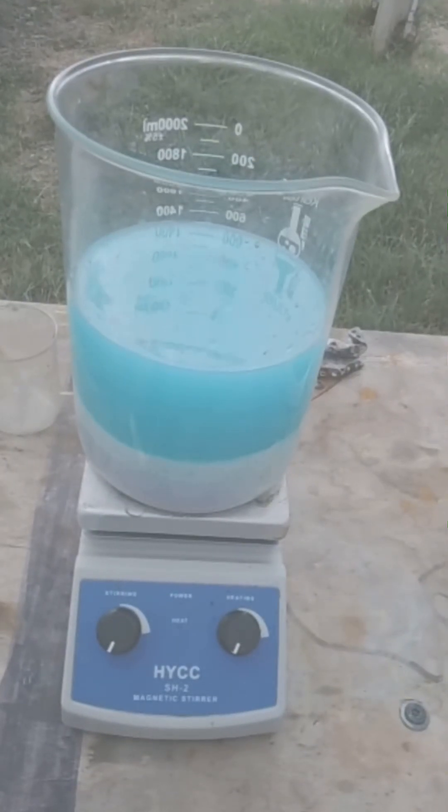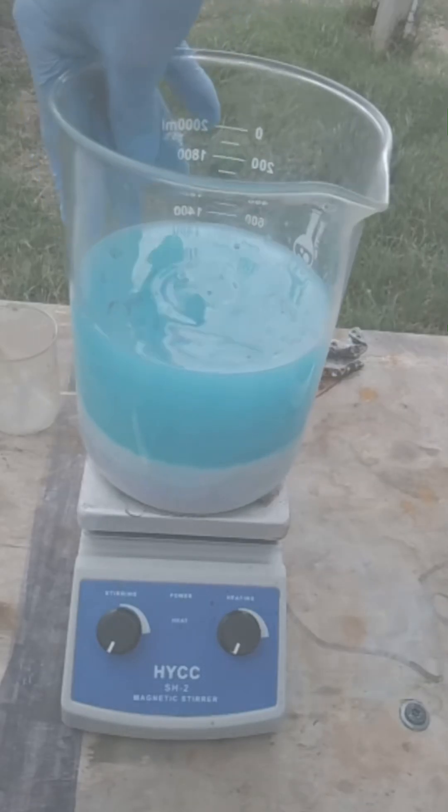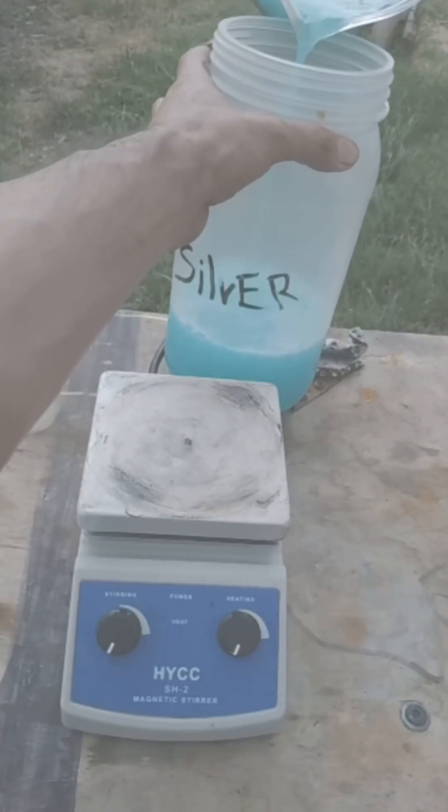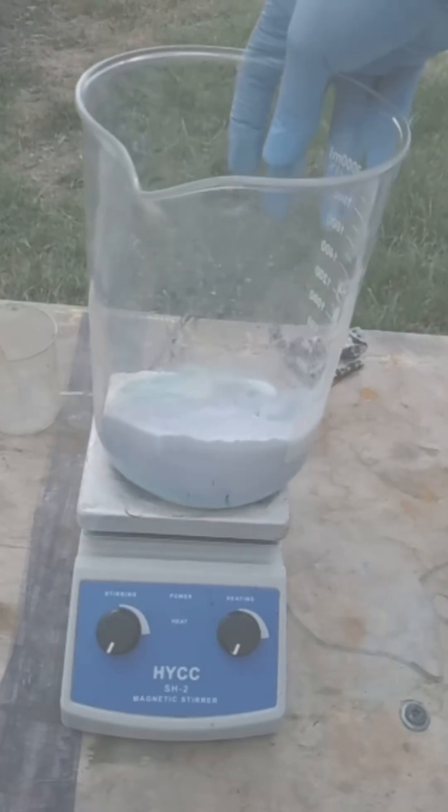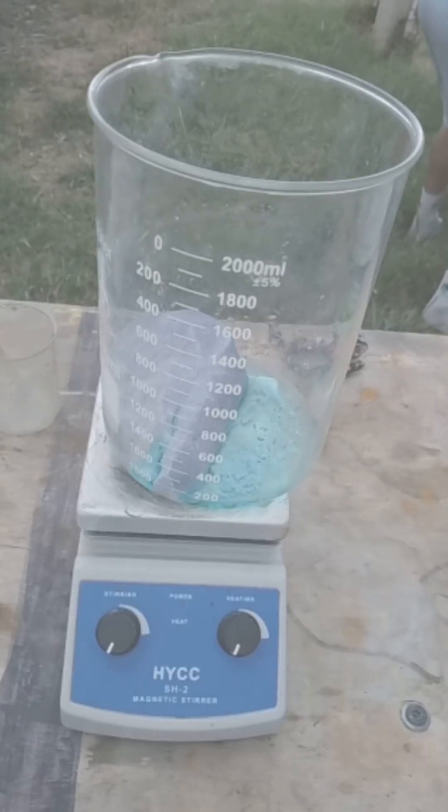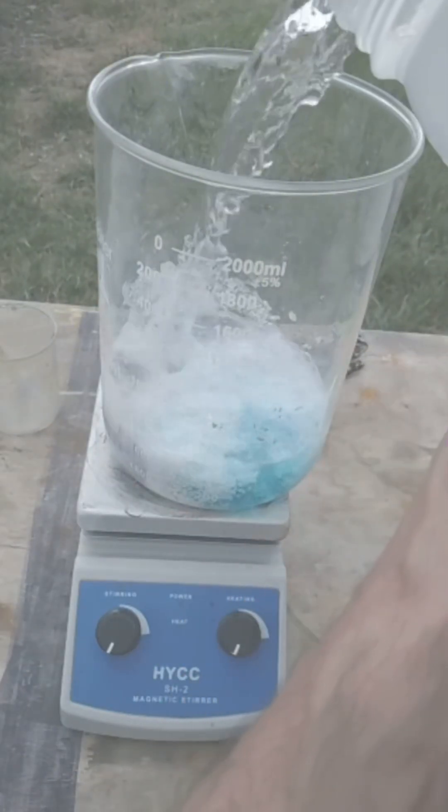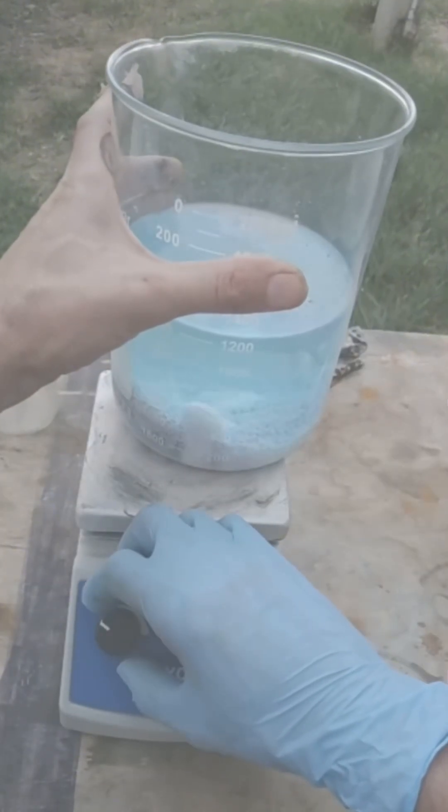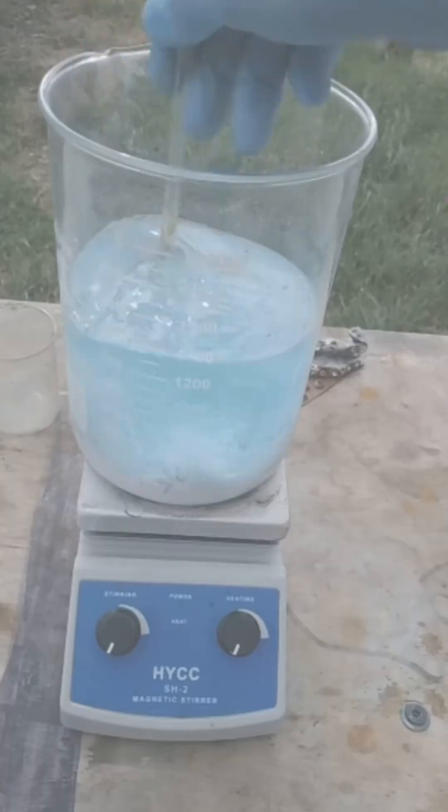Now that I have all my silver chloride practically precipitated out of the solution, what I'm going to want to do is rinse out all of this, which is now copper chloride. Get all that out of my mix. I'm going to do some, this is just distilled water. I'm going to fill up a bunch of distilled water. As you can see, it's still kind of blue, so if it turns blue it still indicates that there is still some copper chloride inside your mix.